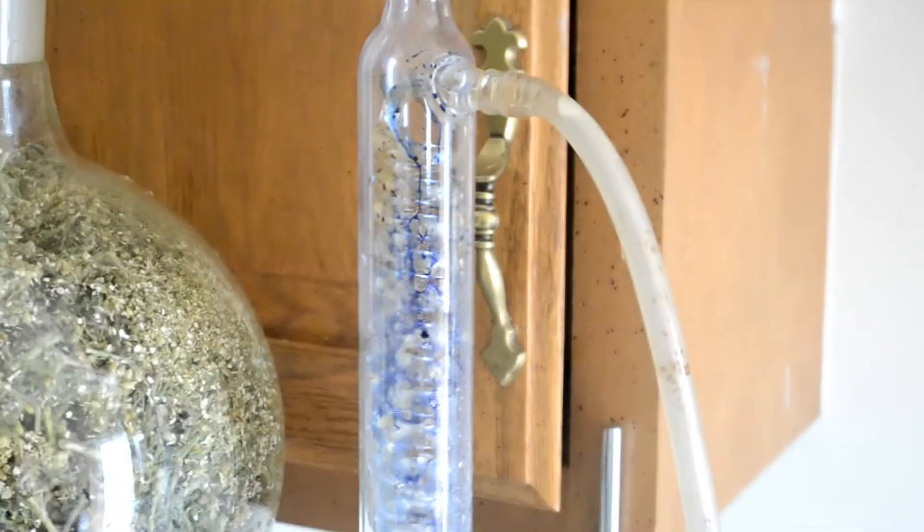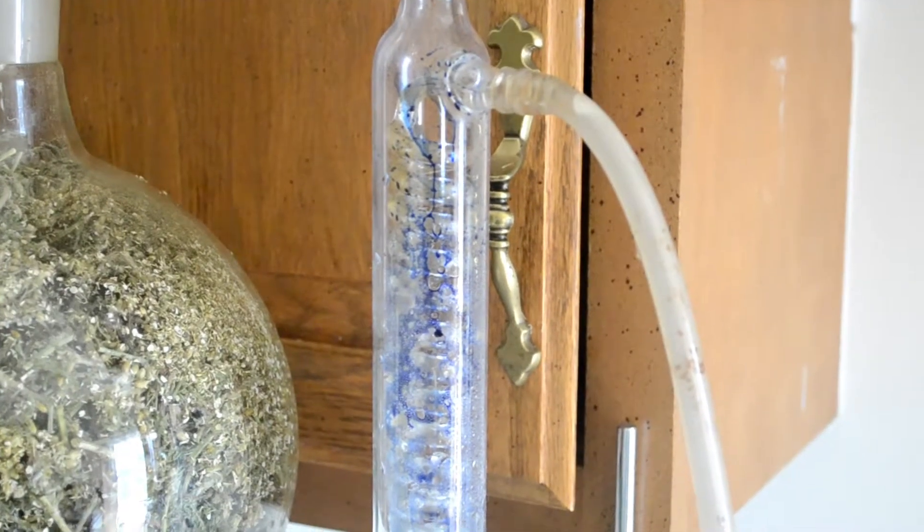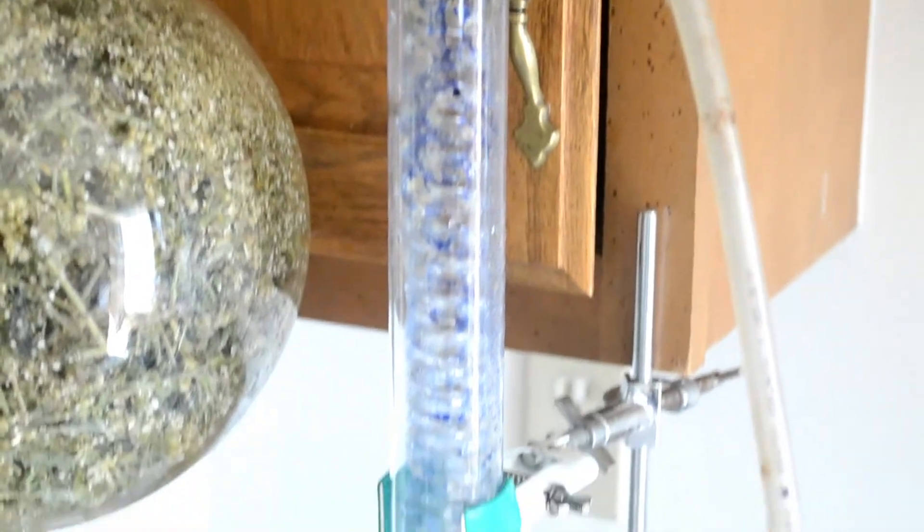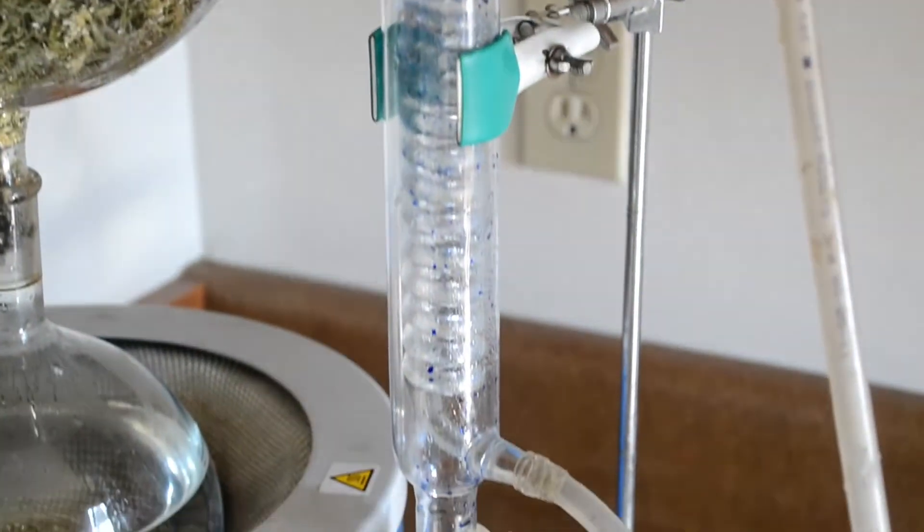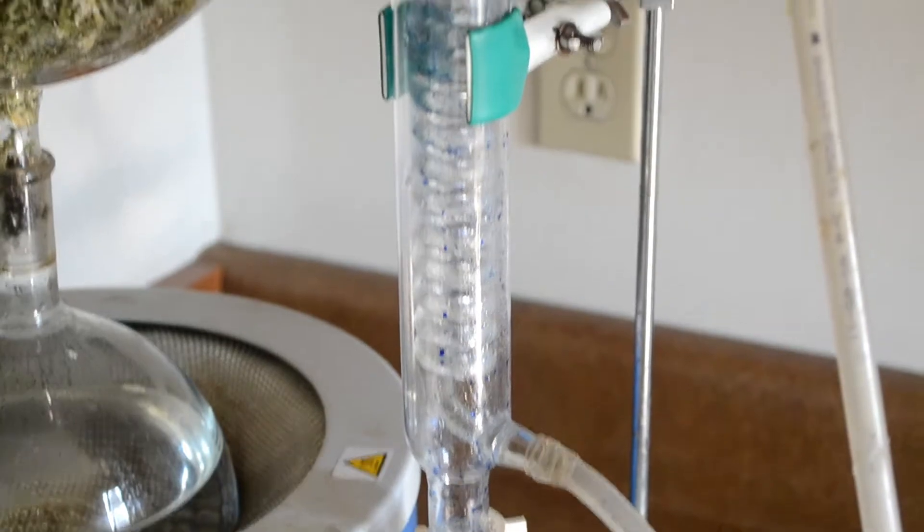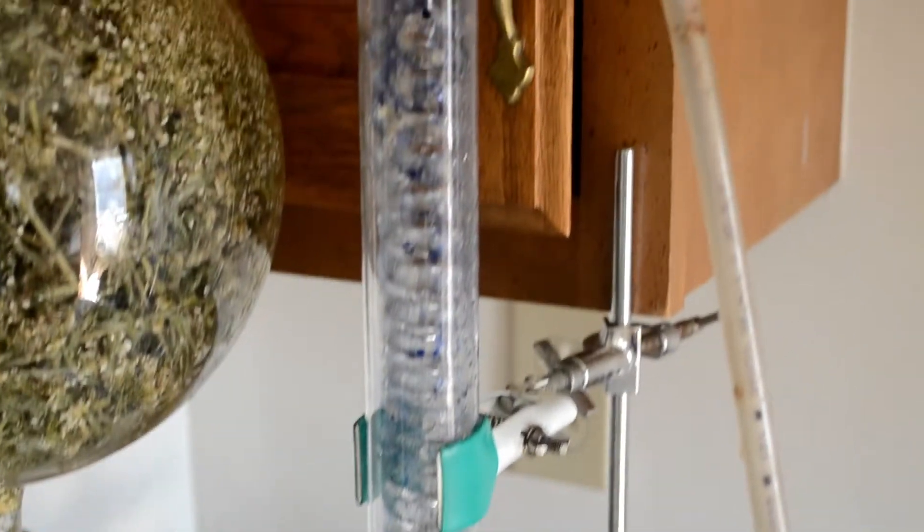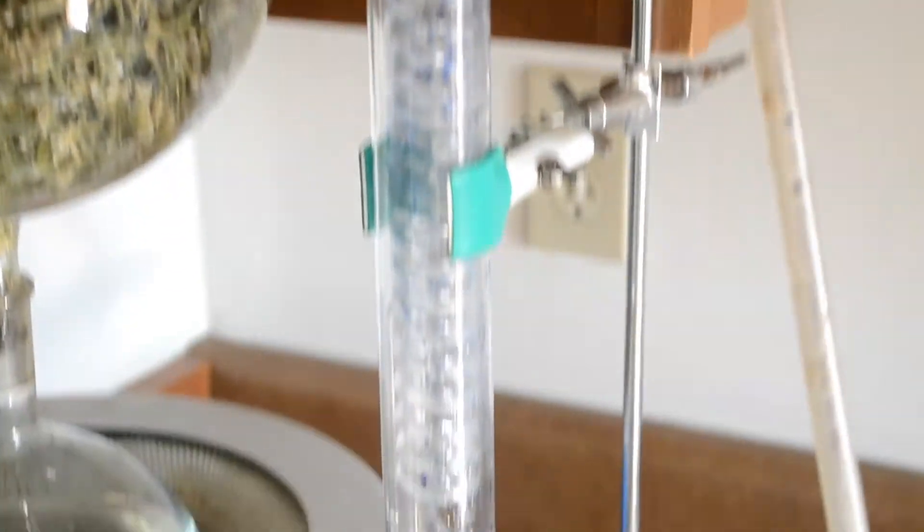And an inside out condenser where the water actually runs through the coil and the essential oil condenses on the outside. It's a lot easier to clean.